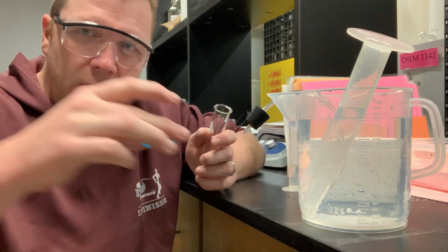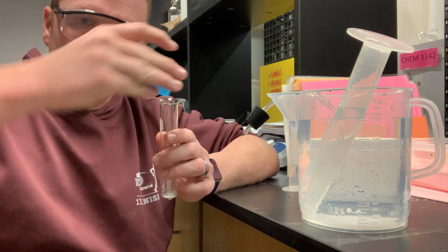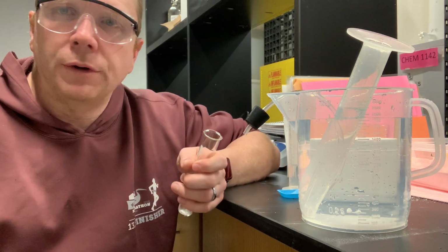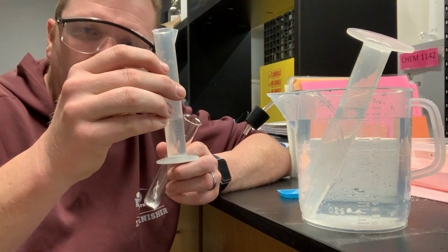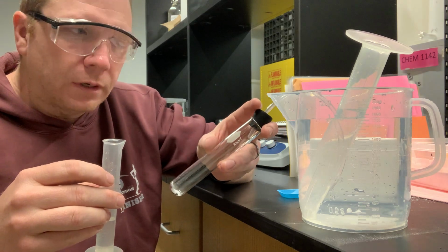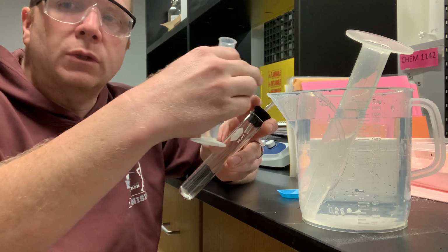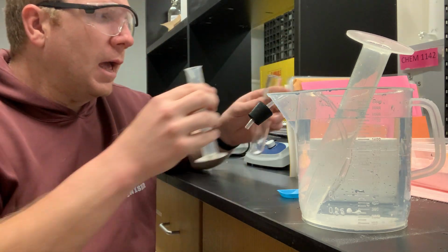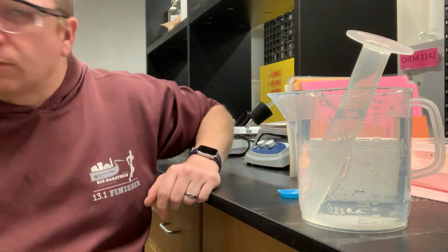What I'm going to do is transfer my sodium bicarbonate into my test tube. Now, the next thing that I'm going to do is transfer my acid from my grad cylinder into my test tube and very quickly, but carefully, cap it so that any gas that is produced flows through this tubing into my grad cylinder. Since I'm handling an acid, I definitely want to go ahead and put some gloves on.